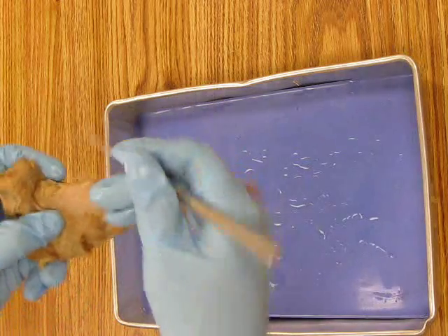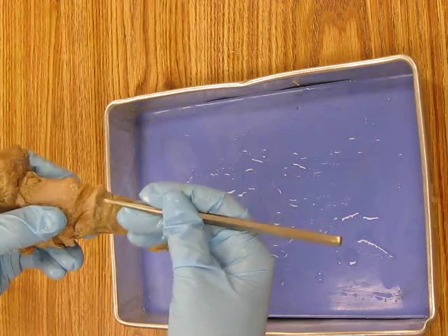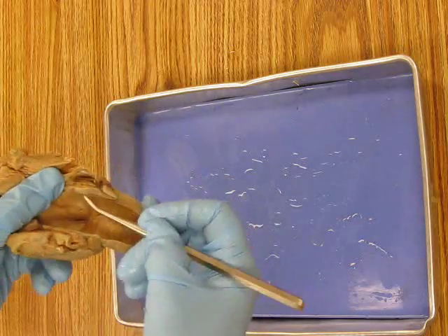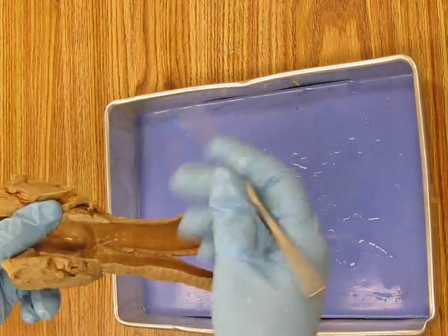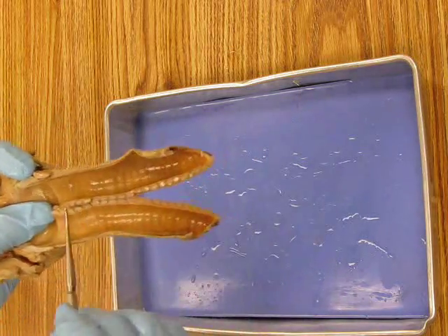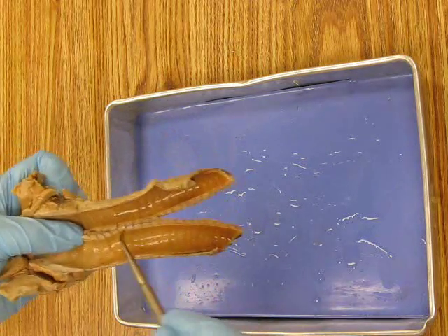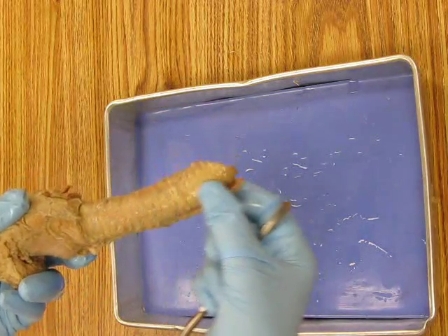You're also going to identify the thyroid cartilage, okay, and the cricoid. Now, the cricoid, you can see, is very thin in cross-section in the front. But as you go to the back, the cross-section is, this is actually cut right there, very long. So this is the ring of cartilage that gets larger as you go posteriorly, cricoid. Okay. The rest of these cartilage, that first one is cricoid, right there. The rest of these cartilage cross-sections are the tracheal rings, or tracheal cartilages that are along the trachea tube. Here's the trachea from the outside.